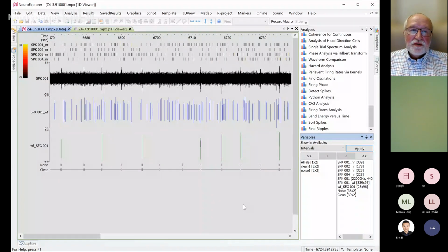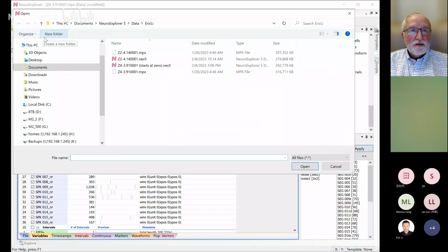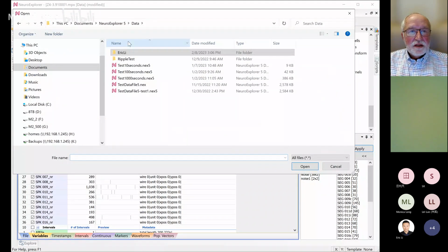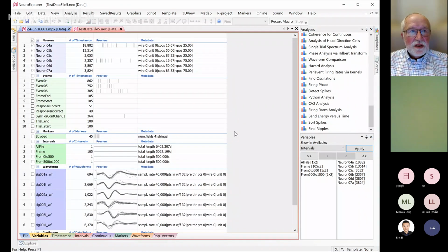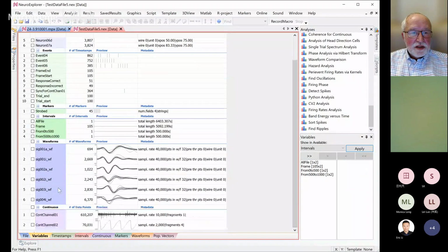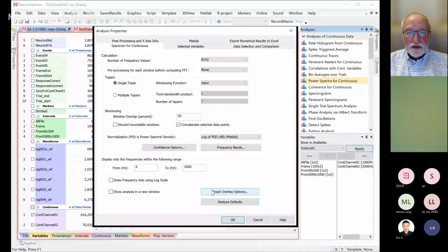It doesn't show itself as high amplitude periods. Yeah. Let me show you how to do this. So I have a data file, and I just open my test data file that comes with the program. And if we analyze continuous channels, let's do, for example, continuous data, power spectra for continuous.